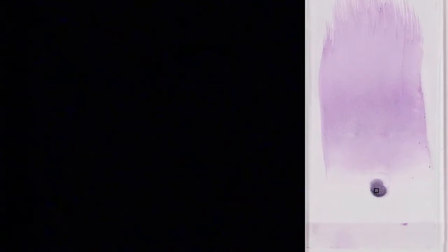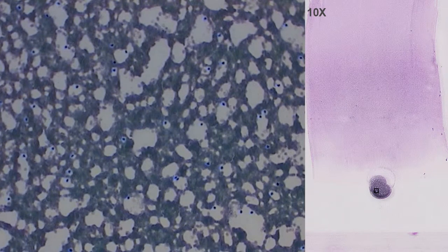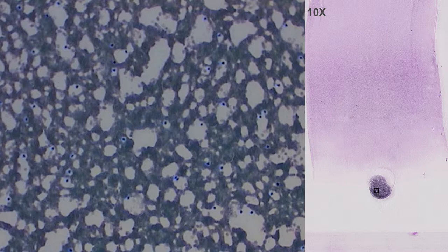As we scan the sample, we are able to see the appearance of the cells. In the head of the sample — the area in which the drop was placed — a greater cellularity is observed. The erythrocytes will be very close, forming aggregates, and the coloration becomes greyish. This zone should be avoided in order to distinguish the different cell types present.